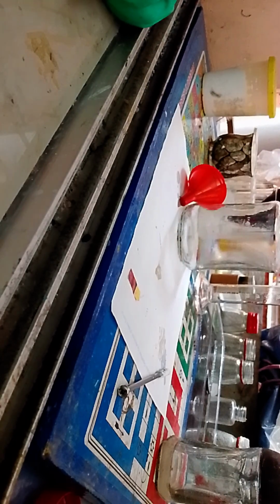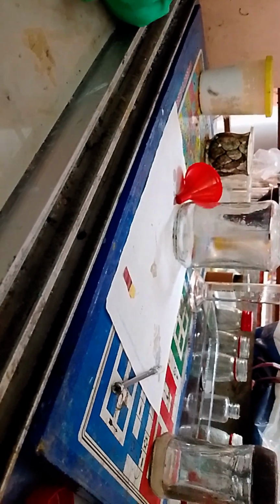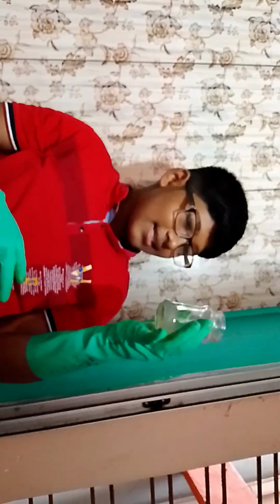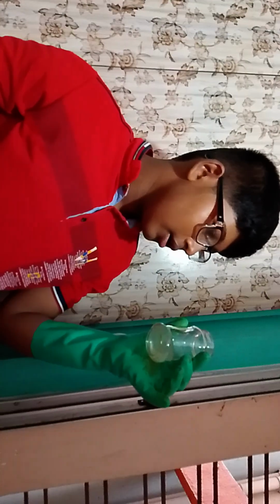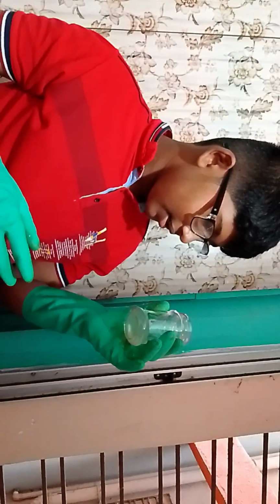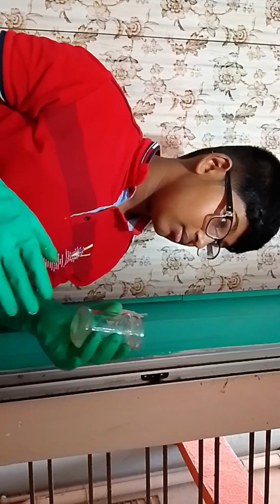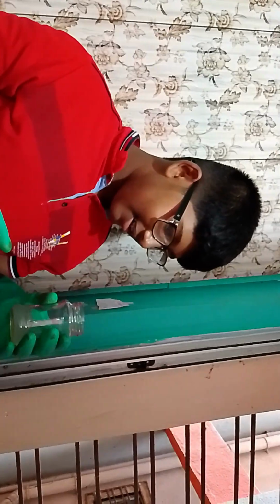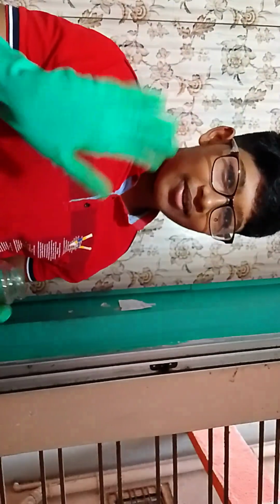I'm like, why is this clear solution turning that into red, blue. Are you acidic or basic? The pH paper is having some bad time to qualify you as acidic or basic. You're not neutral. You smell like chlorine, a little bit of dollar store paper. Don't fear, guys. I'm not gonna drink this horrible stuff.